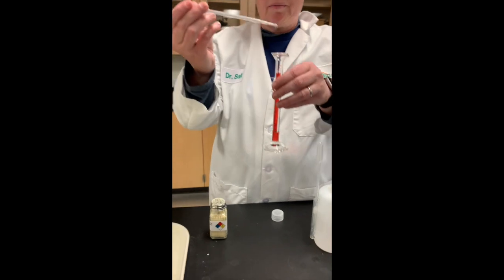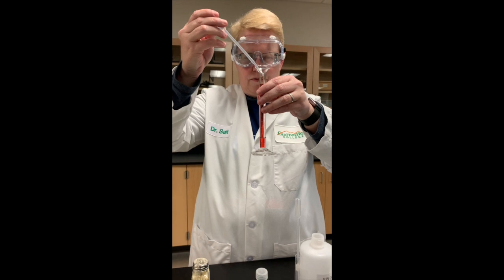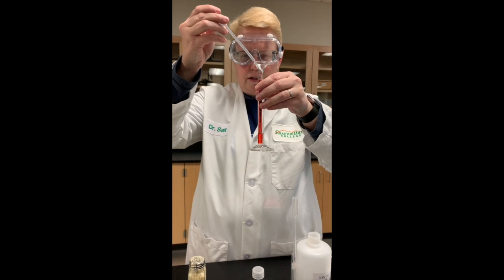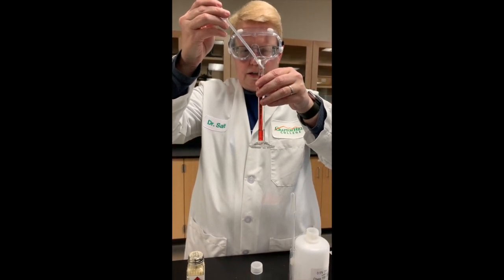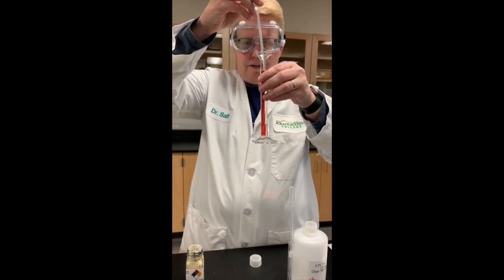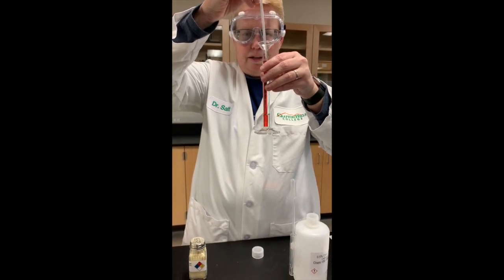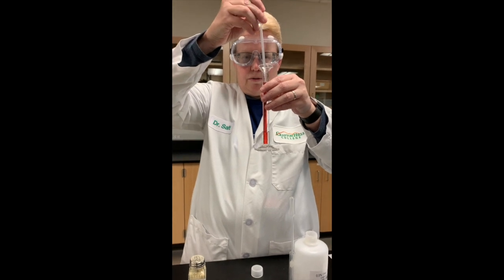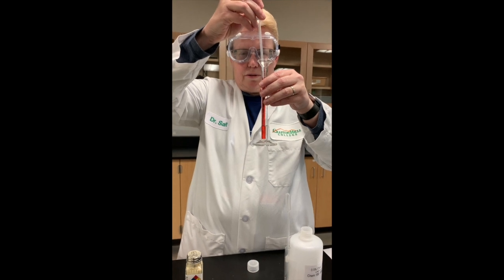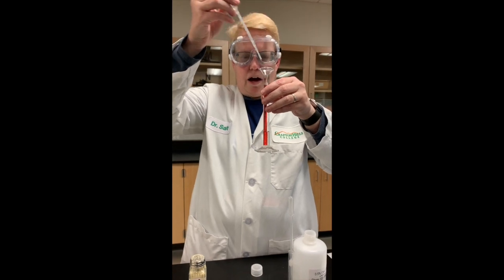So I've got my oleic acid in my dropper, and I'm going to count. 1, 2, 3, 4, 5, 6, 7, 8, 9, 10, 11, 12, 13, 14, 15, 16, 17, 18, 19, 20, 21, 22, 23, 24, 25, 26, 27, 28, 29, 30, 31, 32, 33, 34, 35, 36, 37, 38, 39 about.